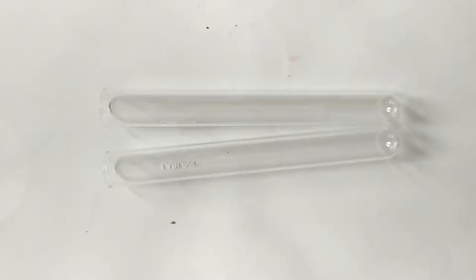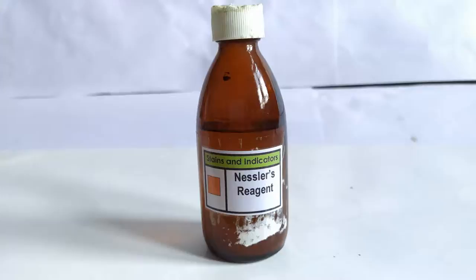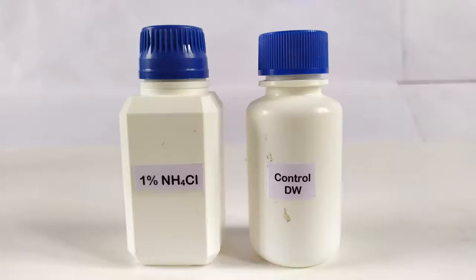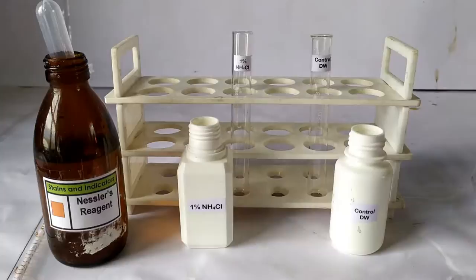To perform this test, we'll need the following: 2 identical test tubes, a test tube stand, a test tube holder, Nessler's reagent, 3 droppers or pipettes, a solution of ammonium chloride or any other sample suspected to contain ammonia or ammonium, and a control sample of ammonia-free distilled water.